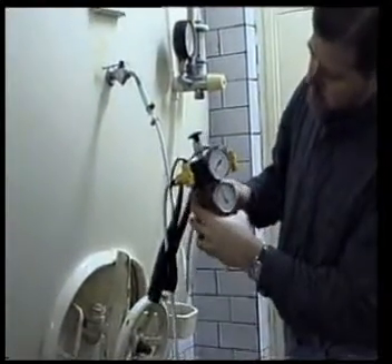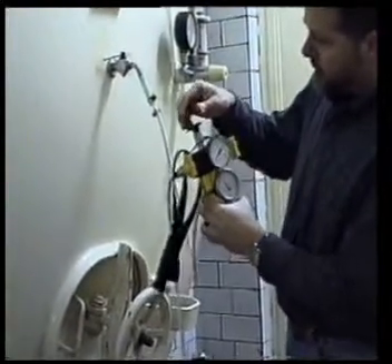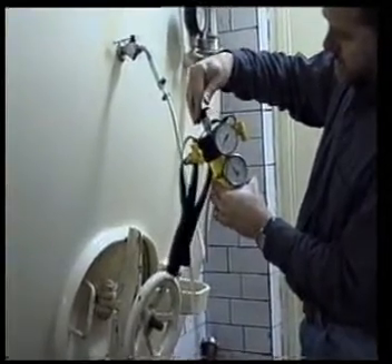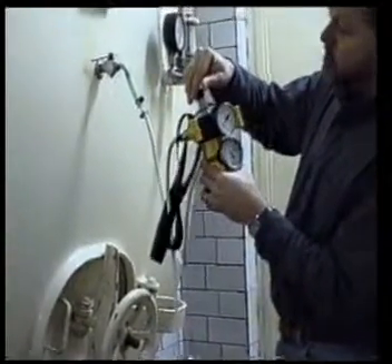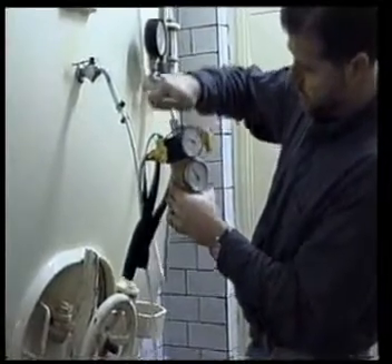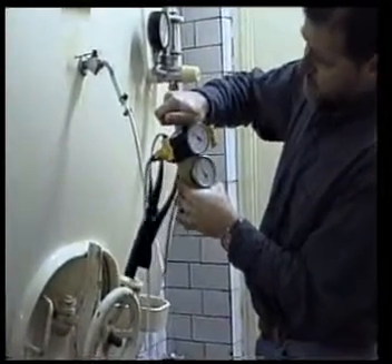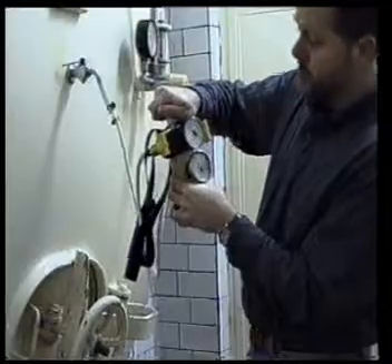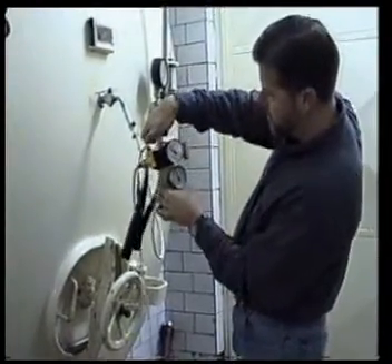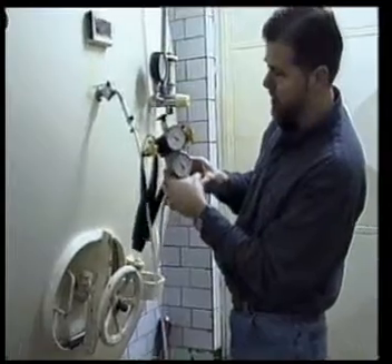It went down close to zero. The next step is to take the pump and lift it out all the way twice and down quickly. It's often a good idea to do it a third time just to make sure you've reached the maximum pressure level of the beer present in the chamber.